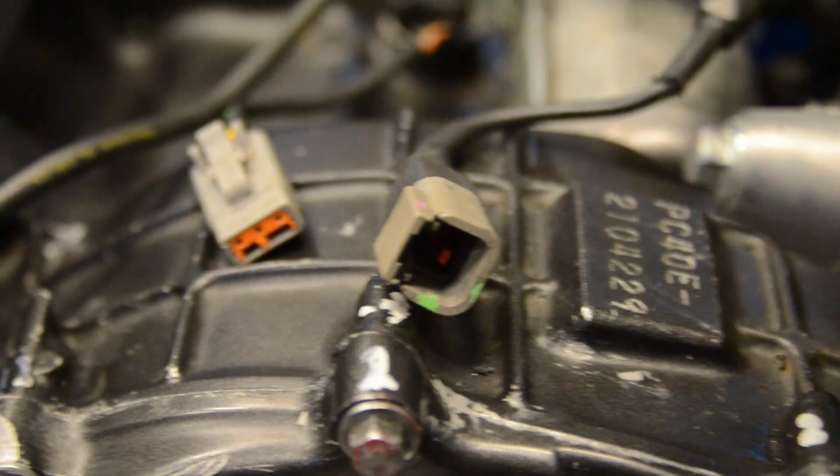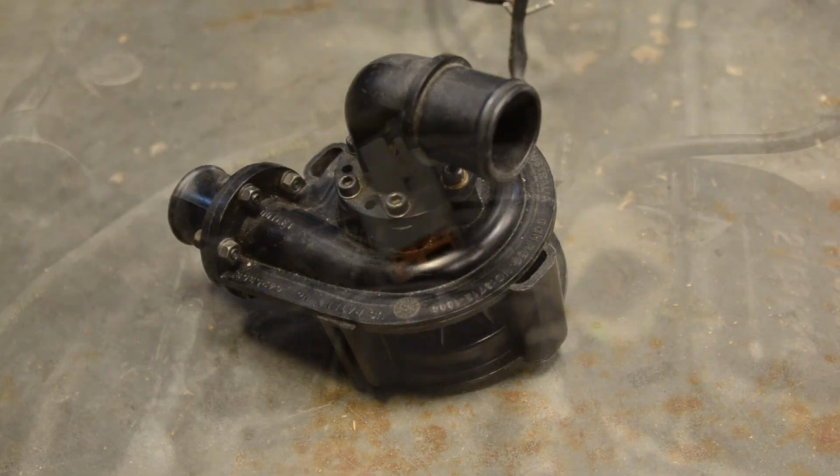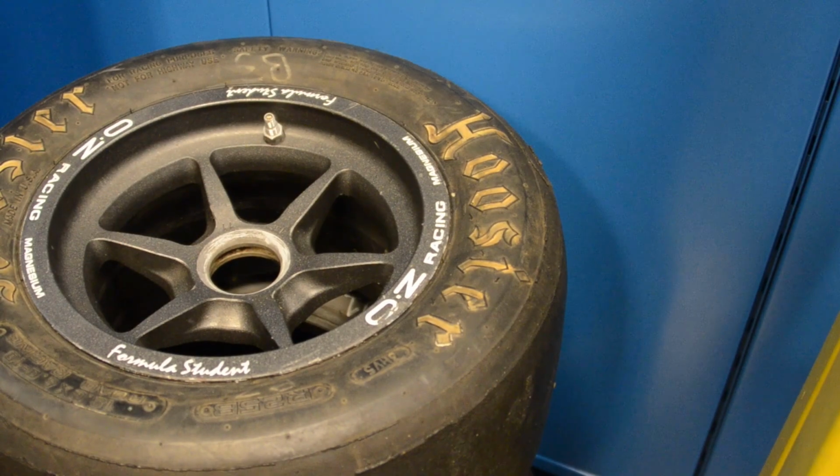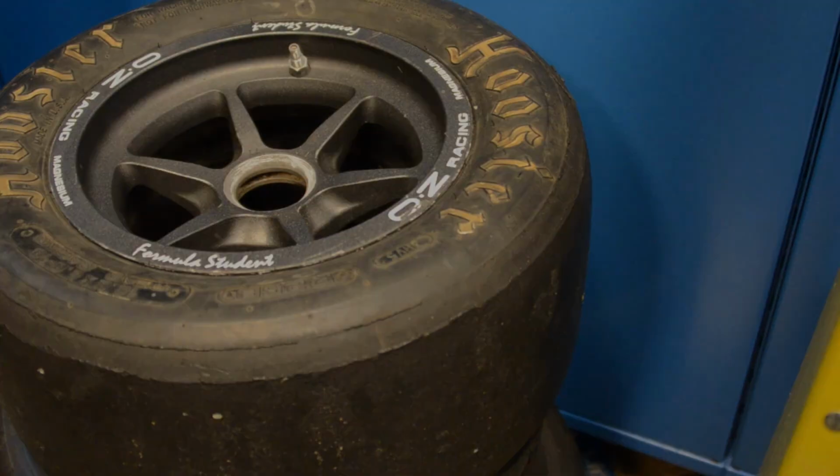DMA data is not just useful for manufacturing, however, and can be used to engineer components containing materials like rubber and plastics that are exposed to a range of temperatures while also subject to mechanical property requirements.